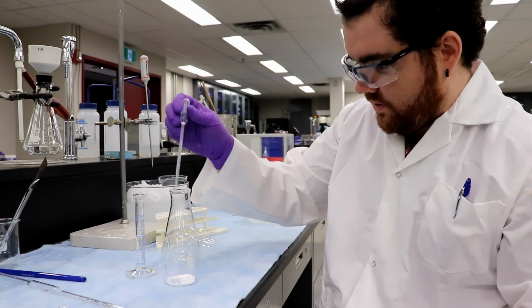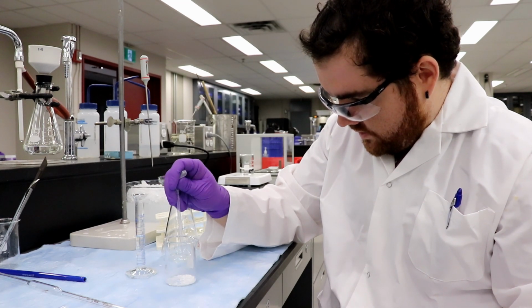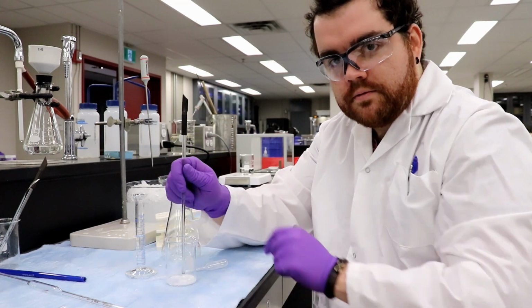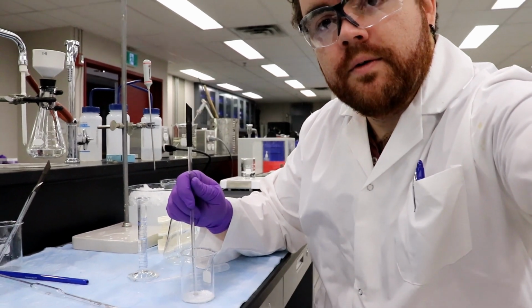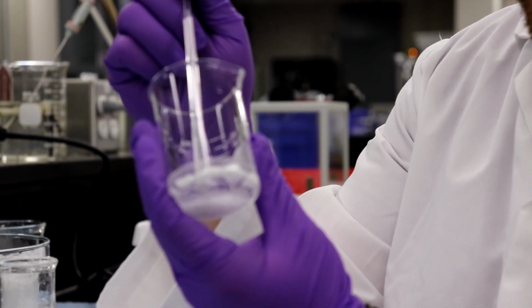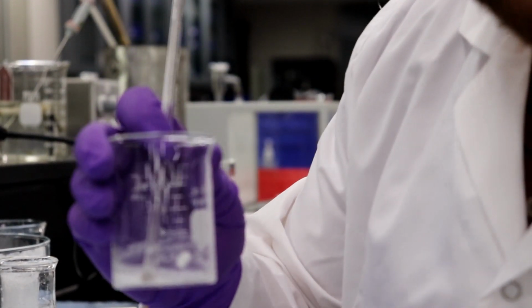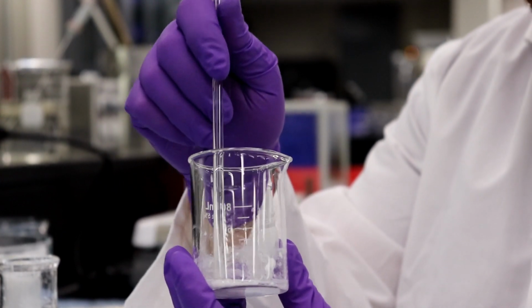Okay, so this is about 3 mils right here. So adding our 3 mils. Putting that off to the side right there. Where are we? There we go, perfect. See if I can get it to focus. There we go. Okay, Ingrid, do you want to add a few more mils for me, please? Sure.